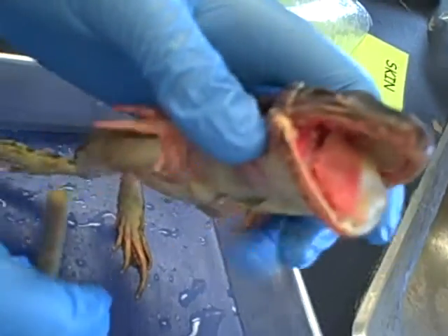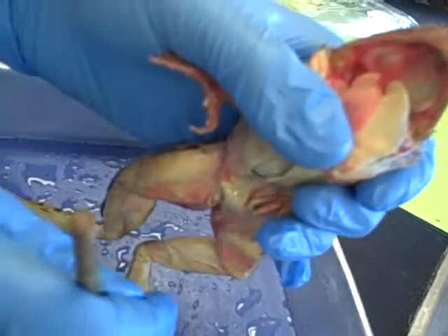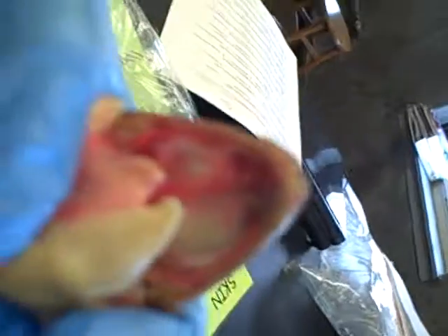Locate the two large circular pads found on the roof of the mouth. The frog retracts its eyes into these pads whenever it swallows. This is helpful because the eyes fill the sacs and help push the food down the esophagus.